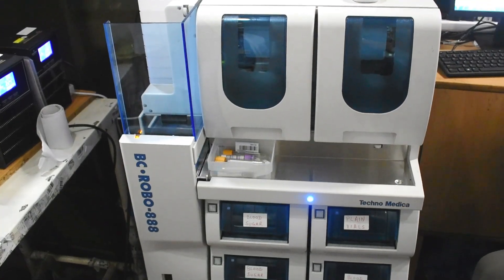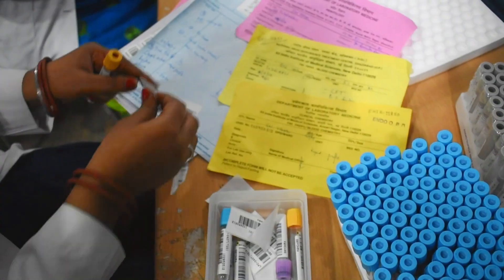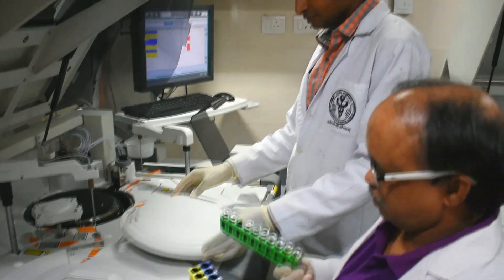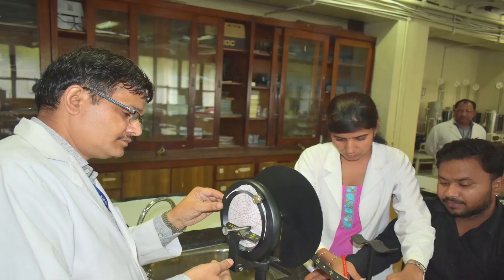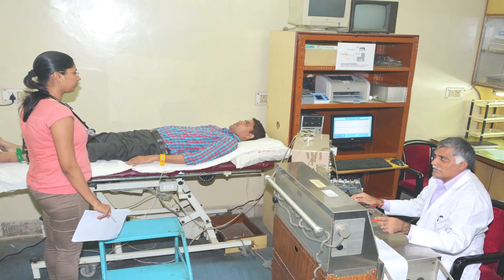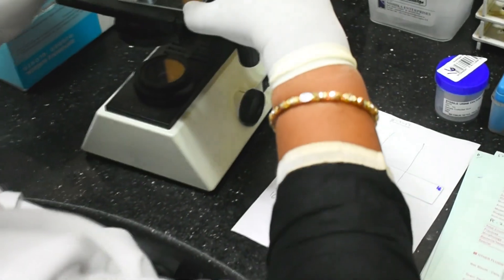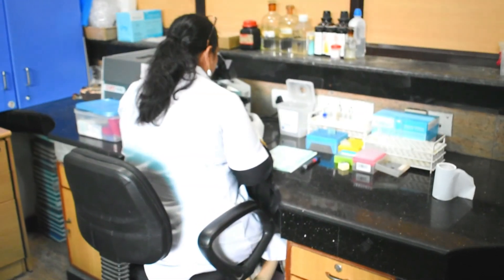Computer-assisted barcoding enhances unique identification of particular specimens, tracking of laboratory samples, and it streamlines laboratory operations to minimize pre-analytical errors to zero, closing the loop of patient safety.